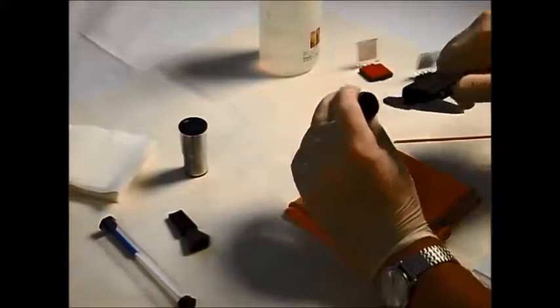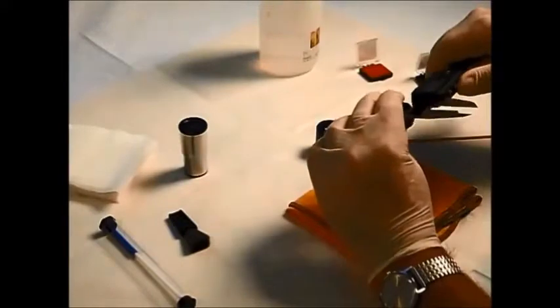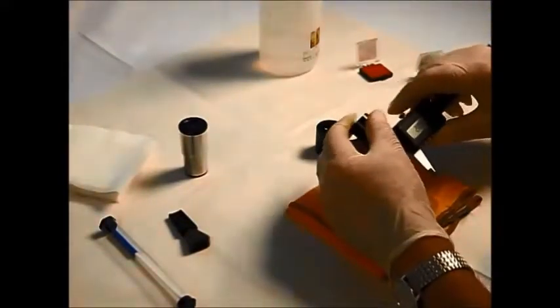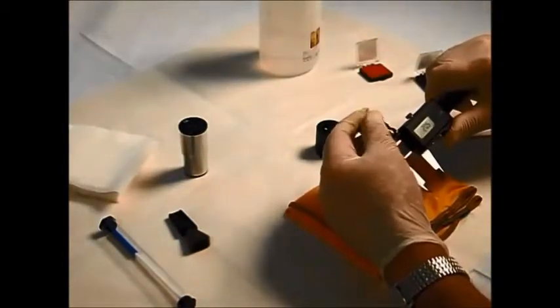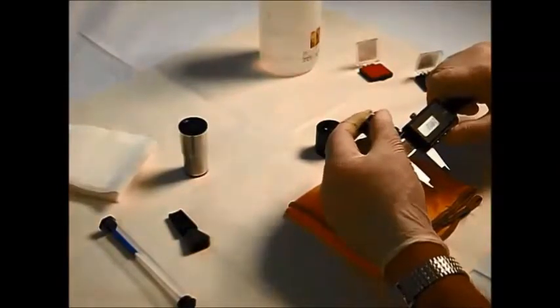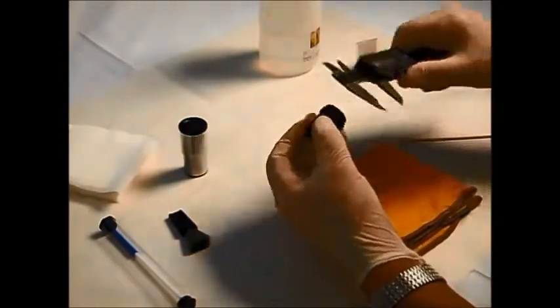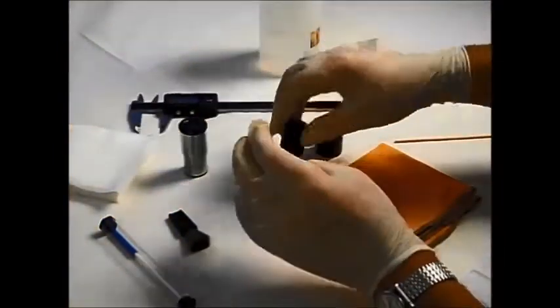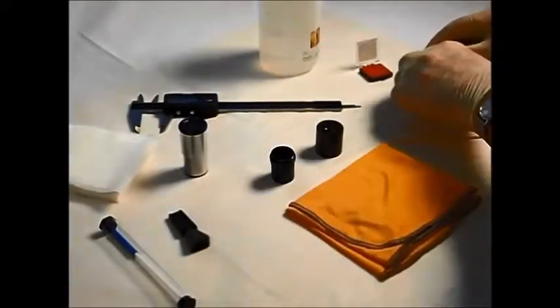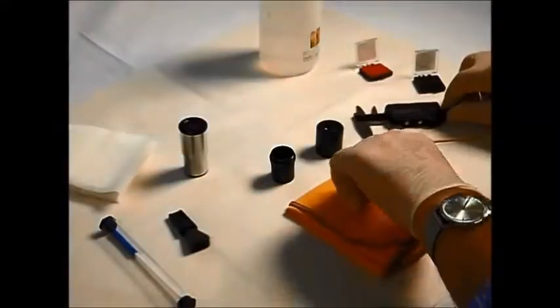So again, zeroing the micrometer. Let's work inside there, working on the right side. There we go. Now this is reading just a fraction over 20.5. It could be a little bit bigger. I think we could possibly get a 20.5, but I think maybe a 20mm would fit in there as well. So I have one here which is actually 20.5 to go into a 20.9 fitting.